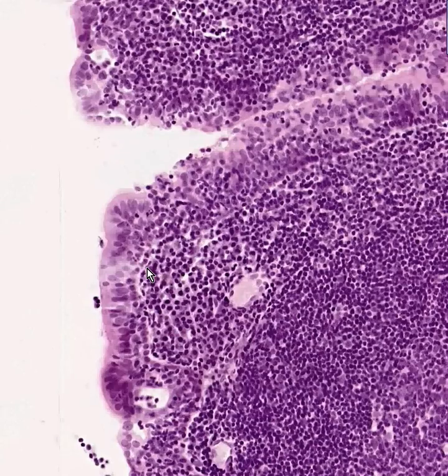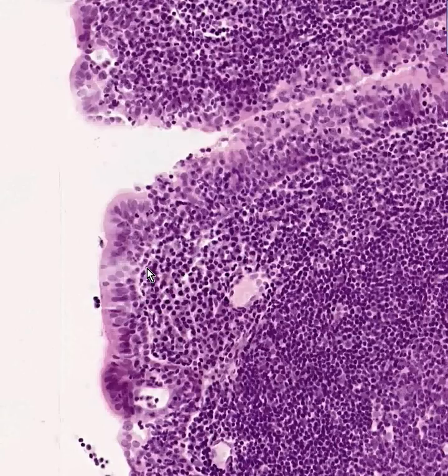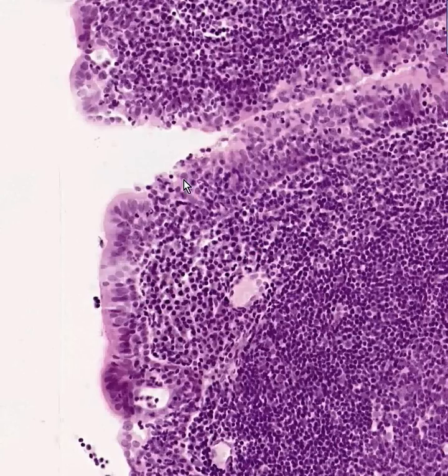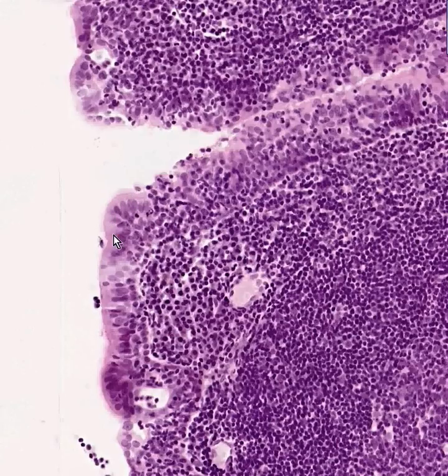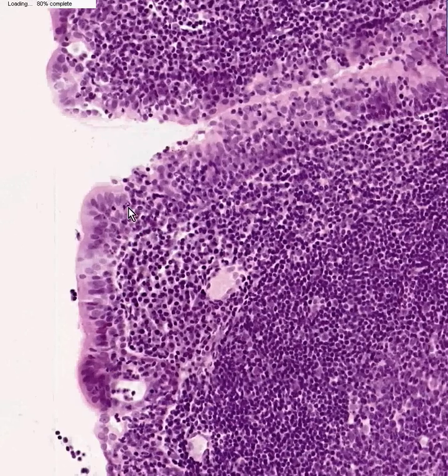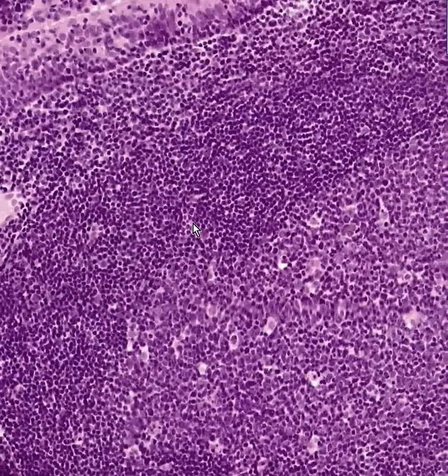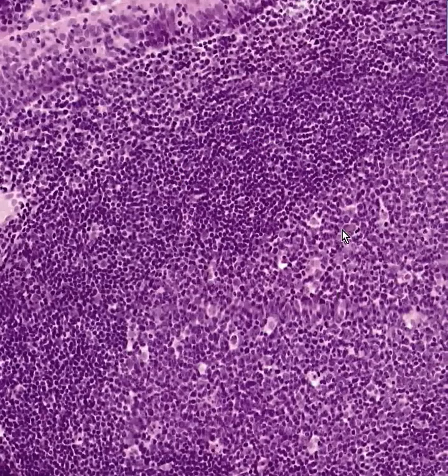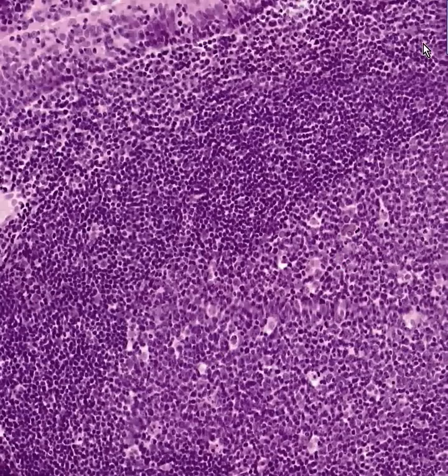They are definitely more visible when enlarged because in their normal state they are just slight thickenings of the mucosa grossly. You can see a little rim of cilia here. You can see single or pseudostratified columnar cells overlying and intermingled with lymphoid tissue, which is dense towards the periphery of the nodule and lighter, bigger, with more cytoplasm in the germinal center or central portion of the follicle.